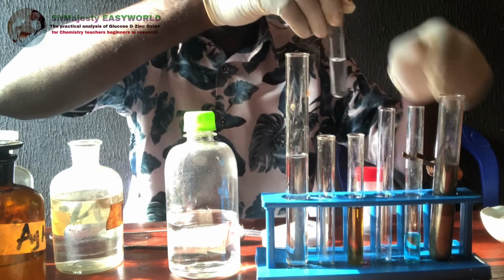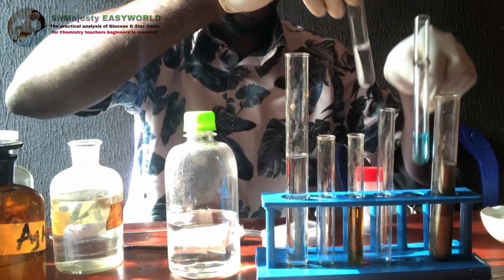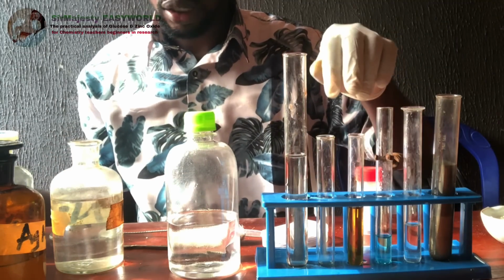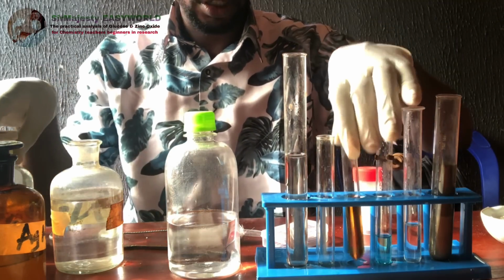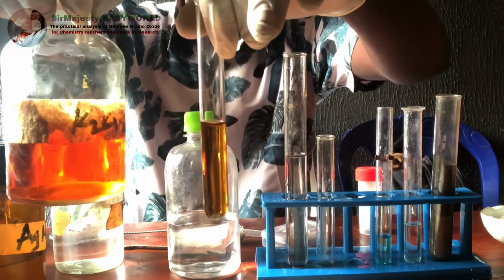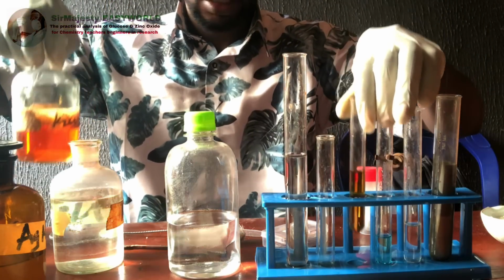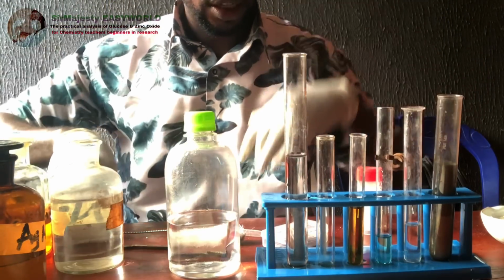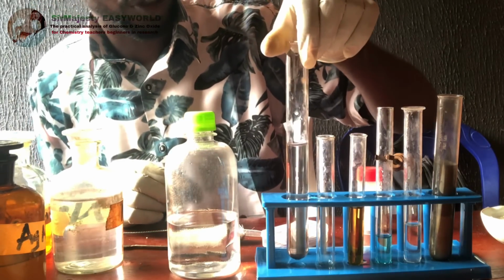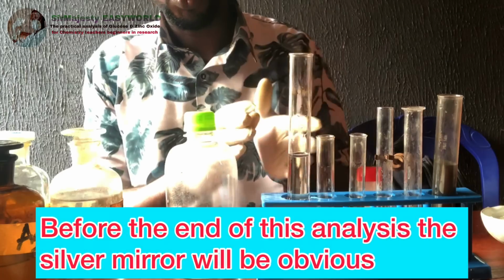Okay, so this is the possible thing we need. Let's check the comparison of color intensity. You see, it has become clearly green on standing. So that's it. So the analysis of glucose is almost complete. This takes time, but it will form in a very smooth way.